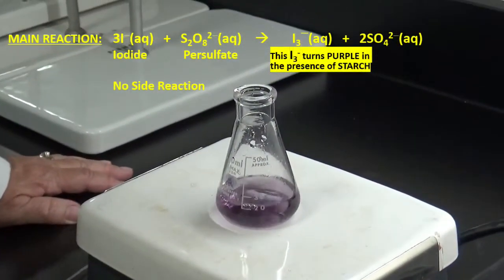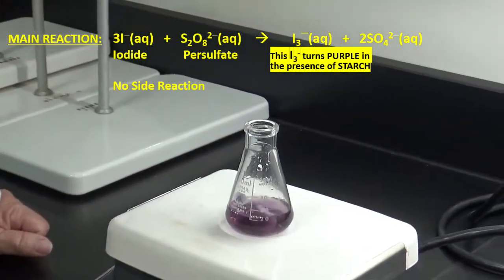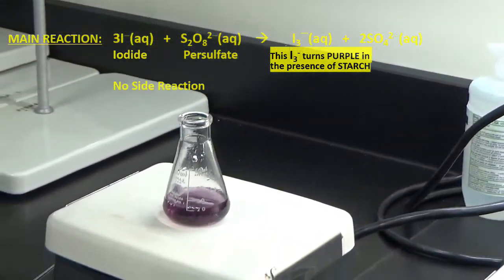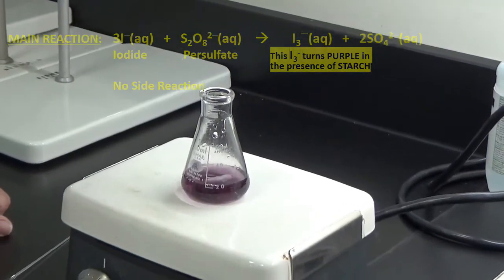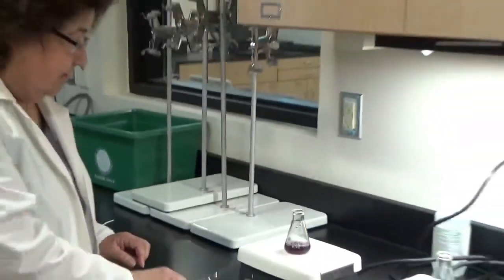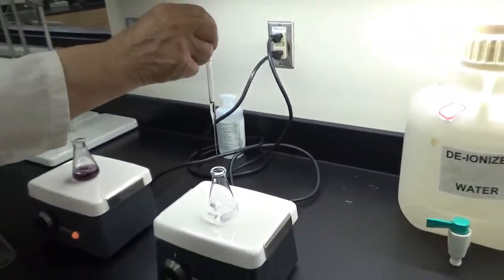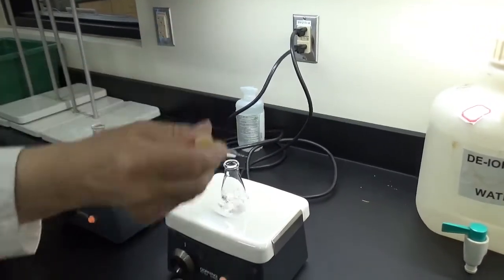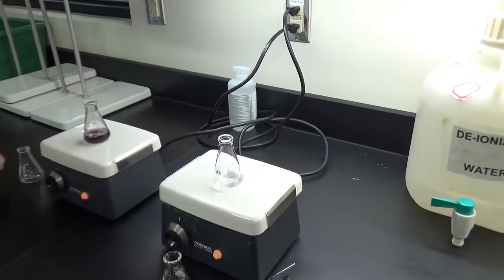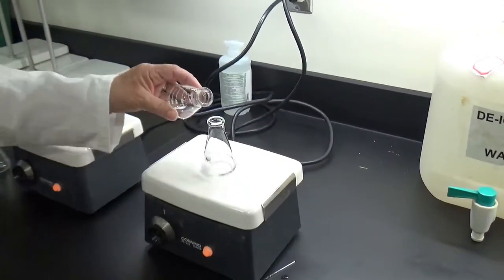You'll notice that right away it started to turn a little bit purple, and it continues to darken. Now, let's try it with the thiosulfate. So I have a little thiosulfate in here. I'm going to add it to solution A. And let's add this to solution B. See what happens.